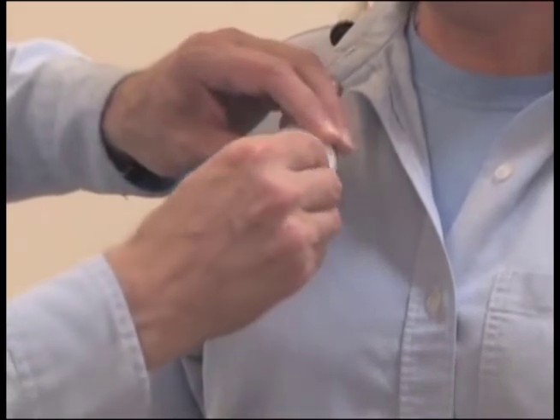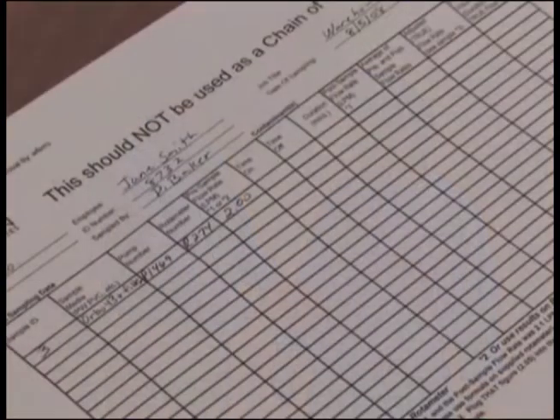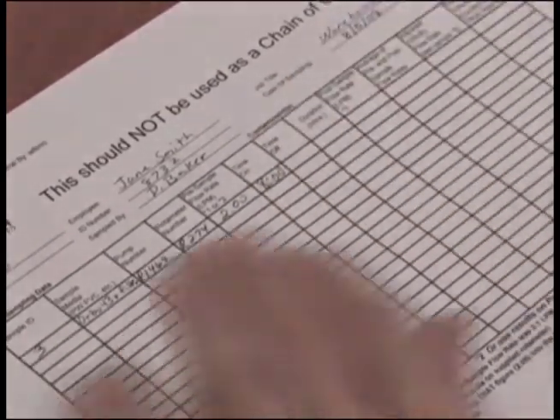Remove the yellow colored nib on the inlet side of the Filter Cassette. Turn on the pump and record the time to the minute that you started the pump on the field data sheet. The counter records the minutes the pump is operating and should read zero when you start the test.